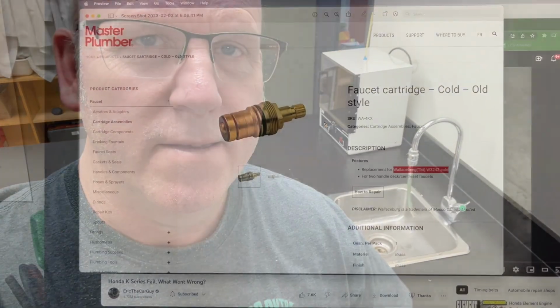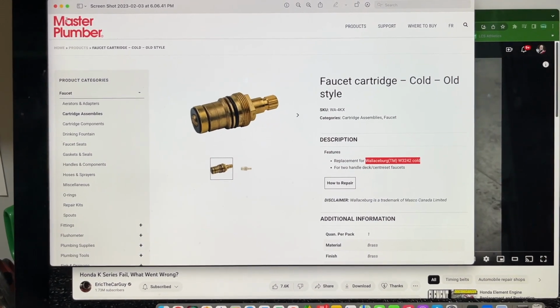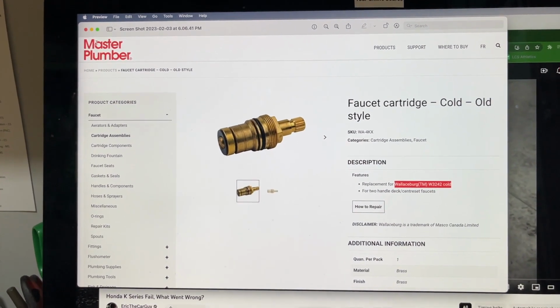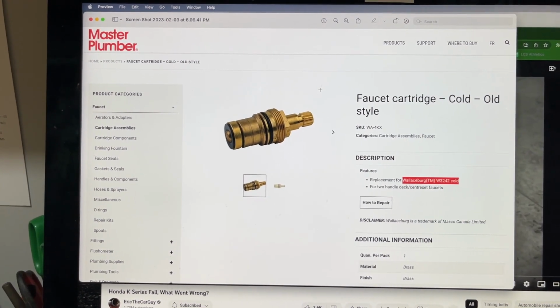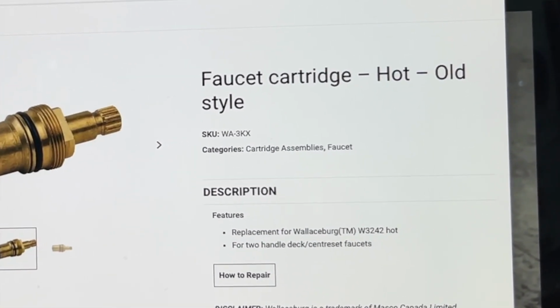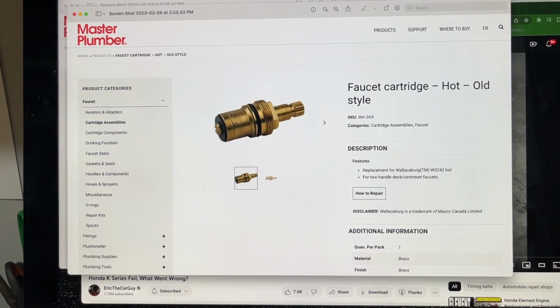Now, I don't know if you noticed when I was operating the faucet that to open it, I actually had to turn it in the opposite direction. Normally, to open a faucet, you would turn it in the counterclockwise direction, right? Righty-tighty, closed, lefty-loosey, open. Your hot is usually on your left and your cold is on your right. And so if this is left, hot, cold, you would turn it this way, counterclockwise, to open it. This works in the opposite direction, which I find interesting. So maybe if, I shouldn't say if, when the next one fails, I can always order this one, which is the same cartridge, but for the hot side. So it would be on the opposite side. So chances are this would open in the opposite direction of the cold one, which is probably the only difference between these two cartridges. Otherwise, they would be identical, I would think.